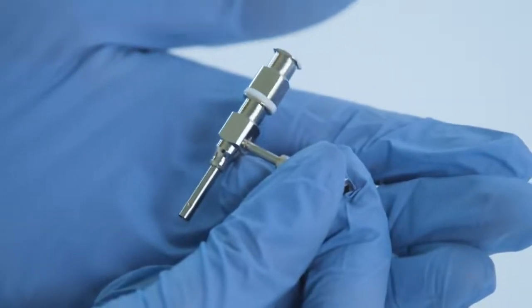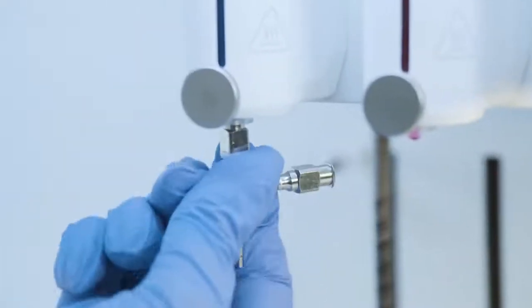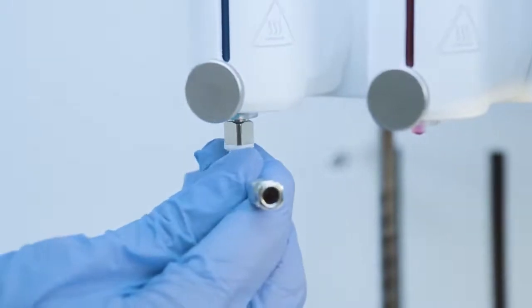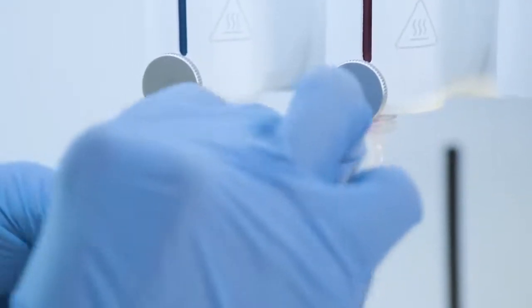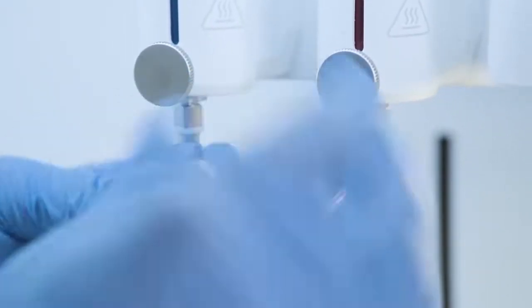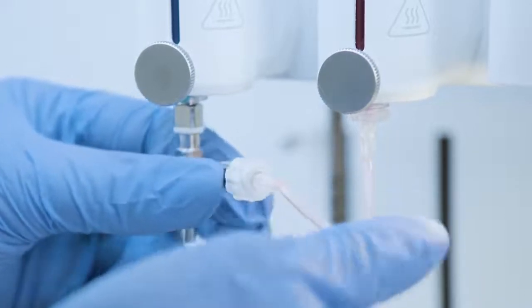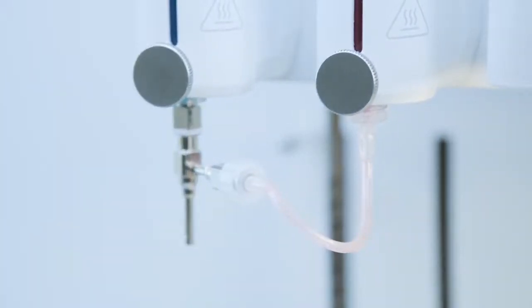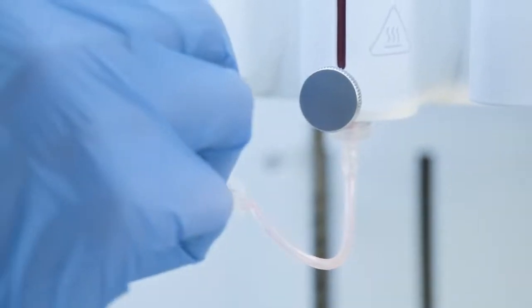The coaxial nozzle should be assembled on the first printhead and the linker tube should be connected to the second printhead and the outer nozzle. Please make sure that the linker tube is not folded, otherwise clogging can make a problem during printing.